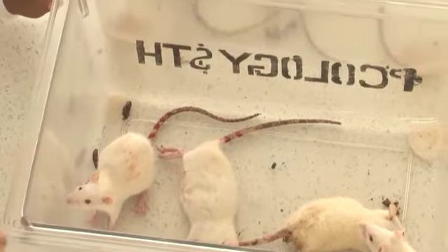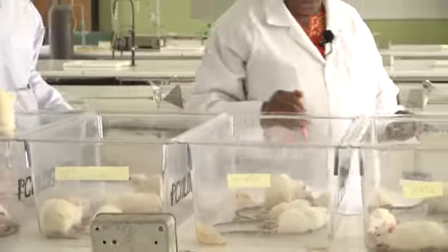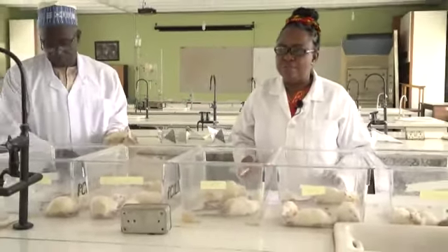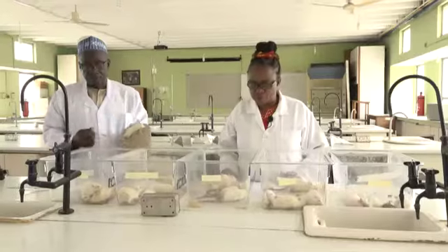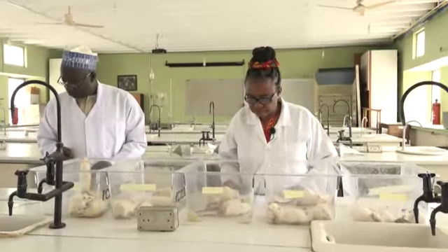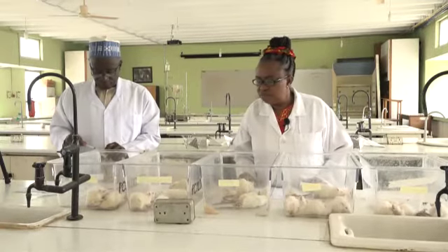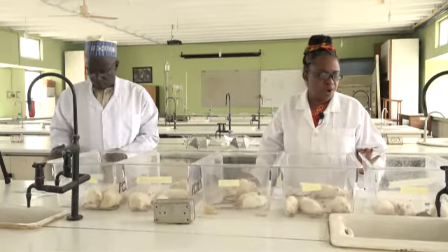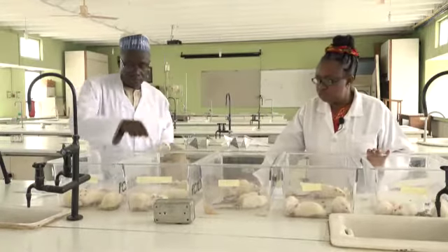Mr. Mohammed, please, can you poison this, please? At the end, we come back to the ethics of using animals in research and of poisoning them just because we can. Please take note of the time between the poisoning and the toxicity, and the magnitude of the toxicity.